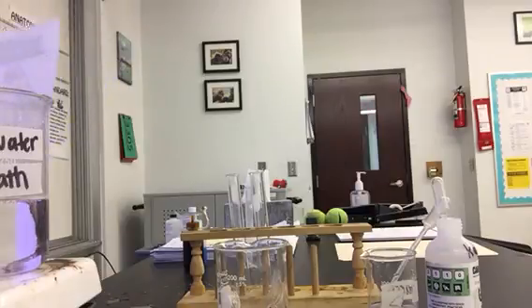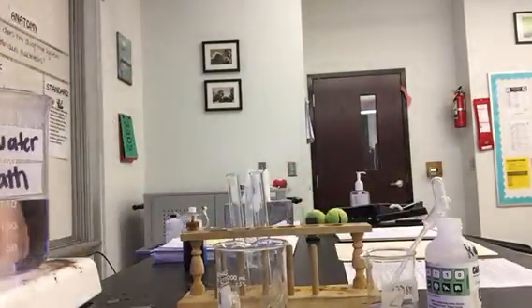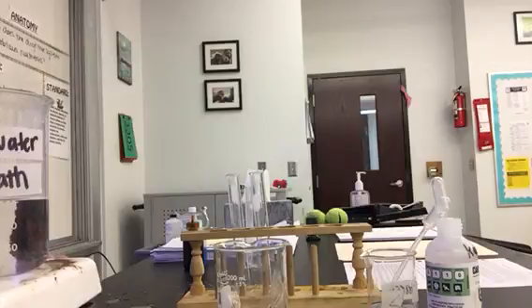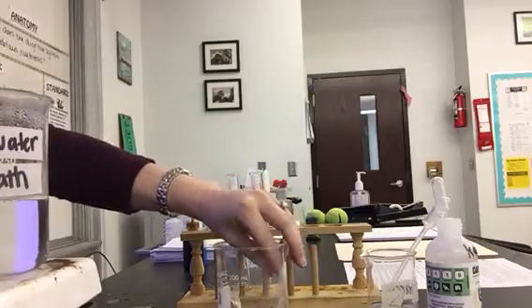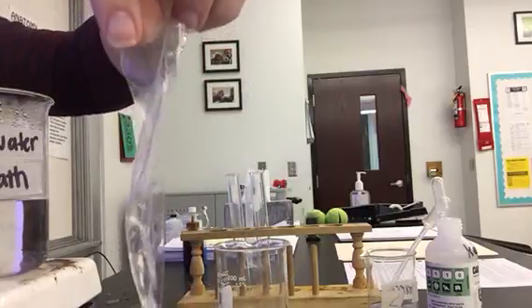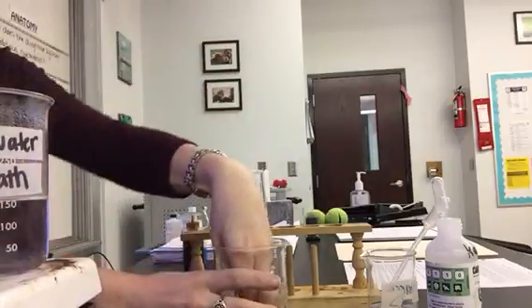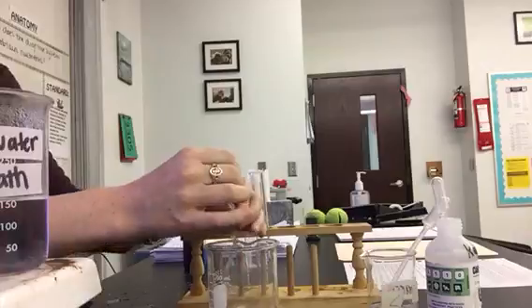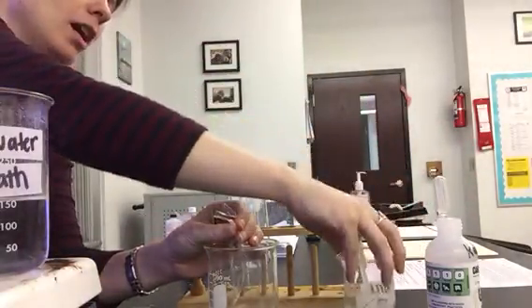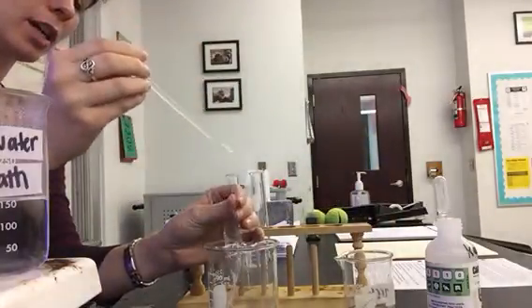The idea here is that we are going to demonstrate that the intestines are semi-permeable and things have to be broken down before they can be absorbed. We have our pretend intestine here — this is a piece of dialysis tubing and I've tied a knot on one end. The other end is open, and I'm going to put starch mixture inside the tube, about two mils worth.